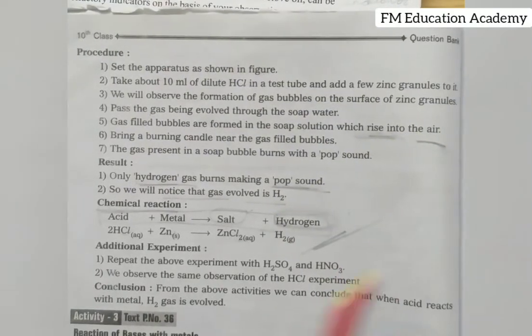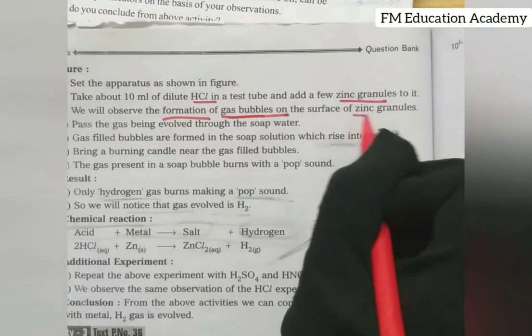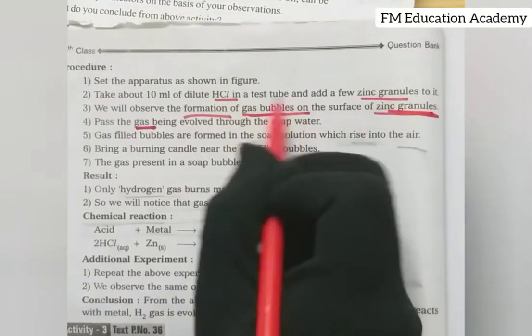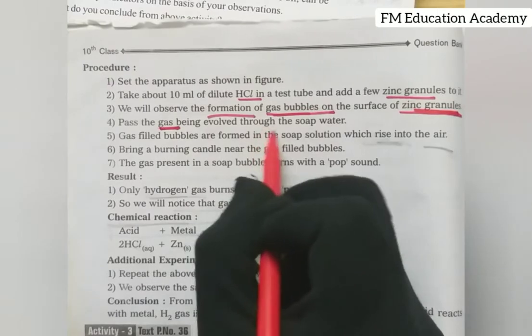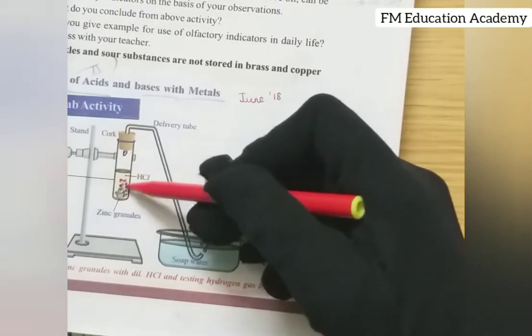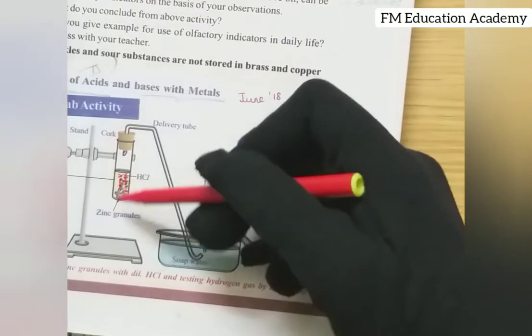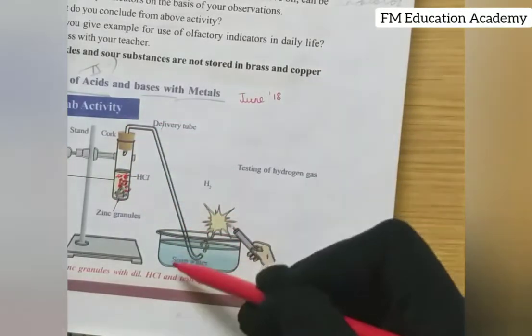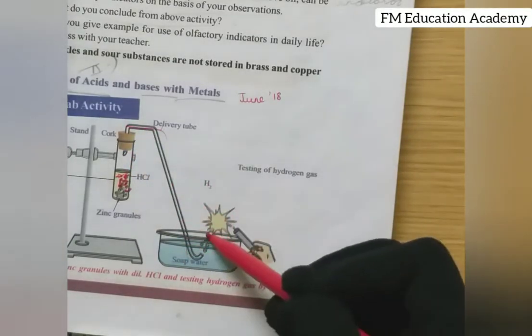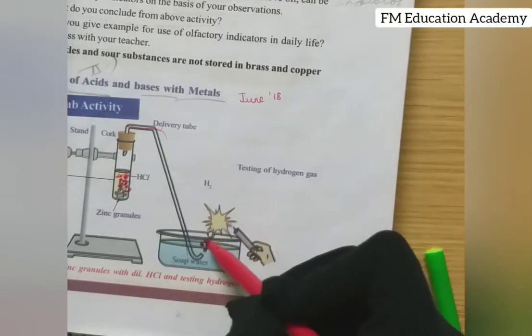When HCl and zinc granules are mixed, we observe that gas bubbles form on the surface of the zinc granules. This gas travels through the delivery tube into the soap water, and you can observe bubbles forming at the outlet of the delivery tube as the gas passes through.